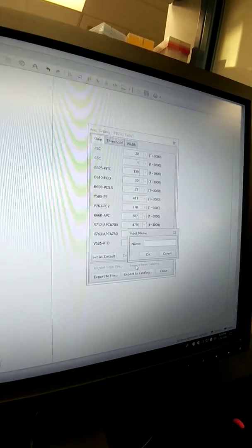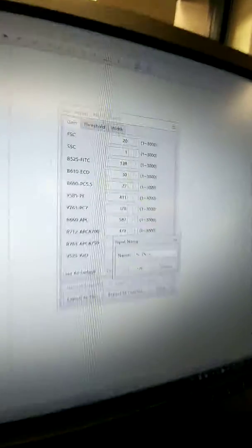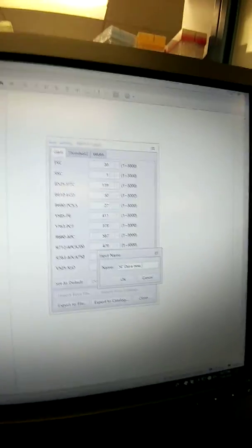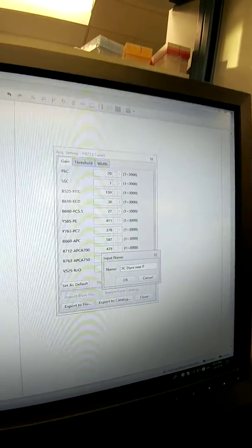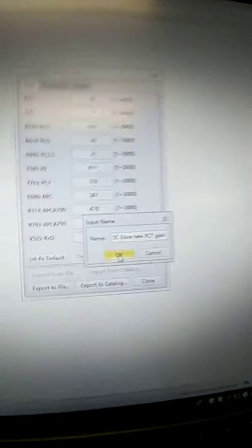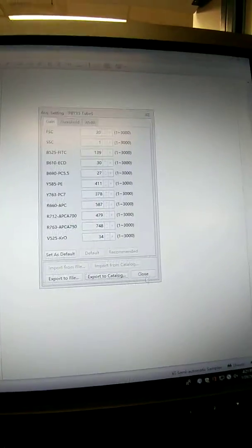And we're going to name it, let's see, for us I do 5C Jura clone. I'm going to put 5C Jura new PC7 gain. Okay, and that way I know which one I want to apply later when I run a new sample. So we'll click OK there.